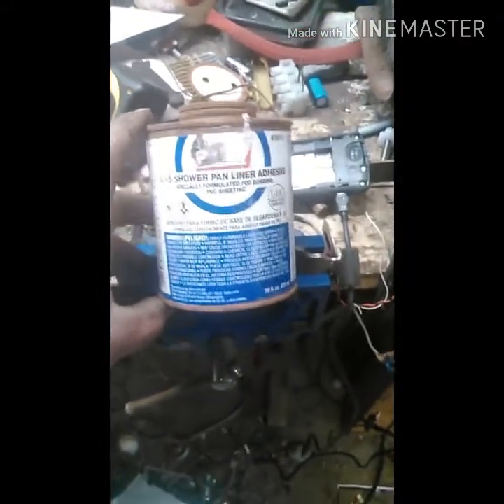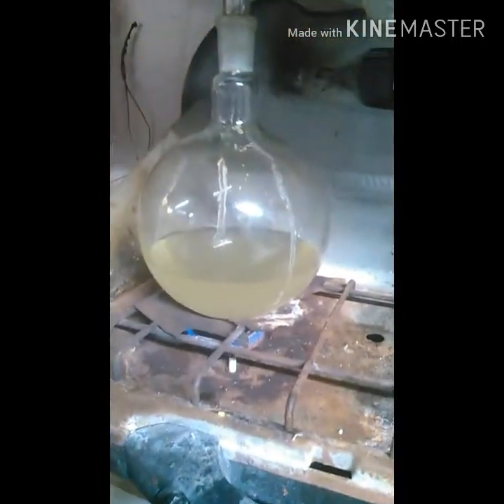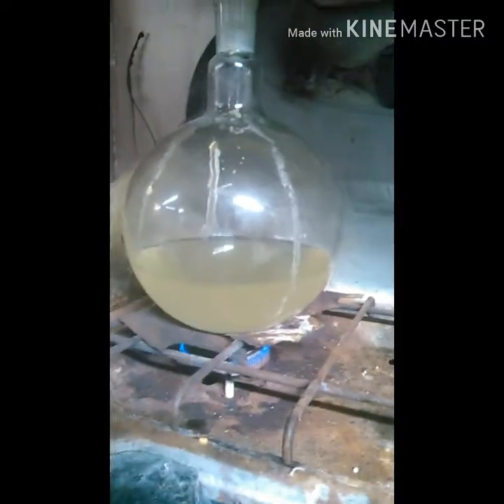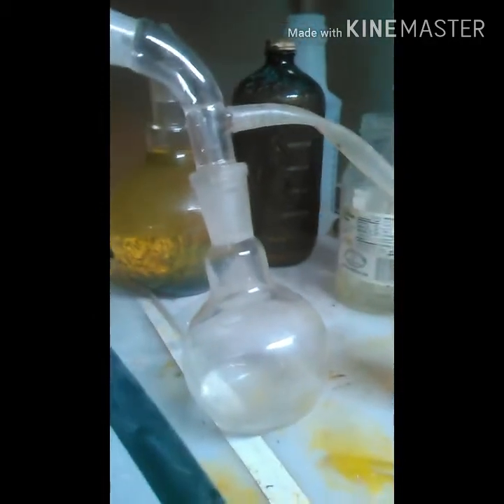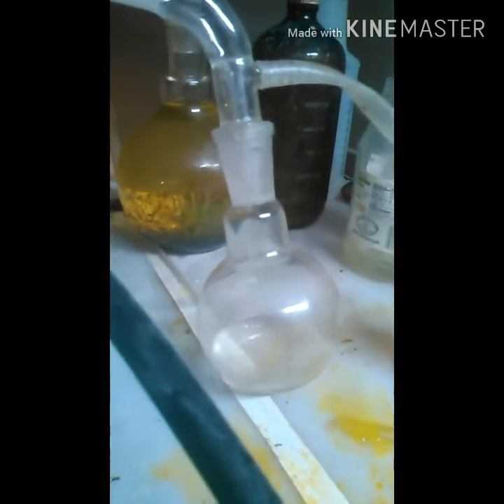I'll go over to my distillation apparatus now. You can see I've got a flame down there — as little and as small as I can get it. Just as soon as it starts bubbling a little bit I turn the flame off. I've got the big distillation apparatus going down to my aspirator.